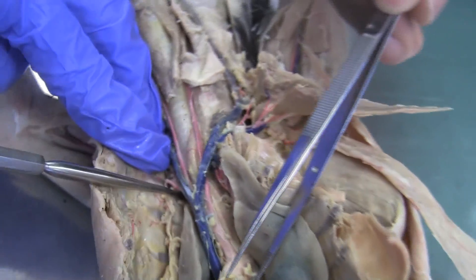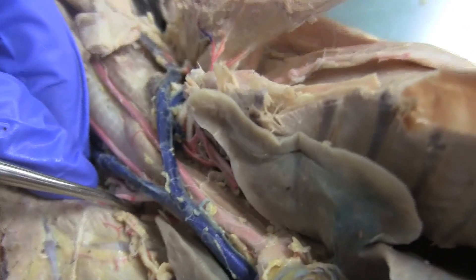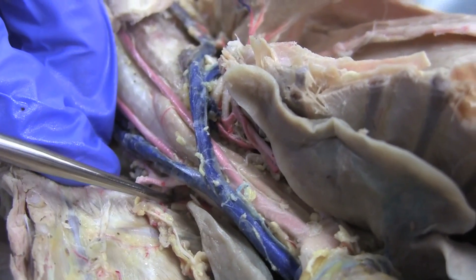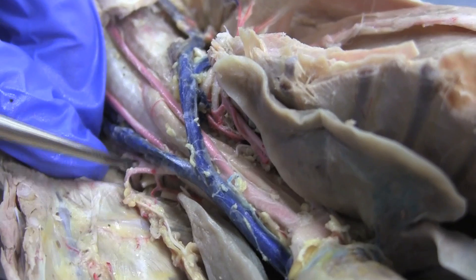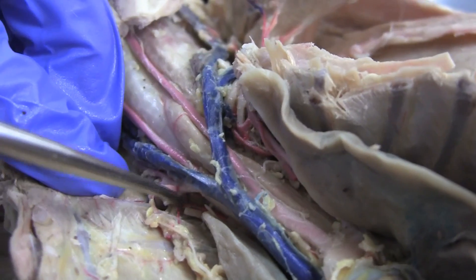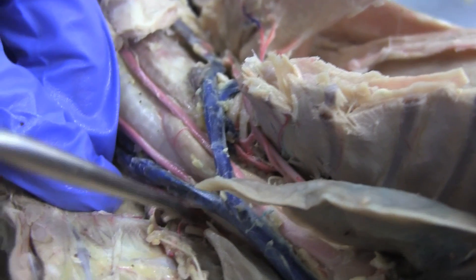I don't know if you can see that with the camera — you're just going to have to trust me on this one. This is the vertebral right here, the first one you can see, and the costocervical branches right off of it in the back.